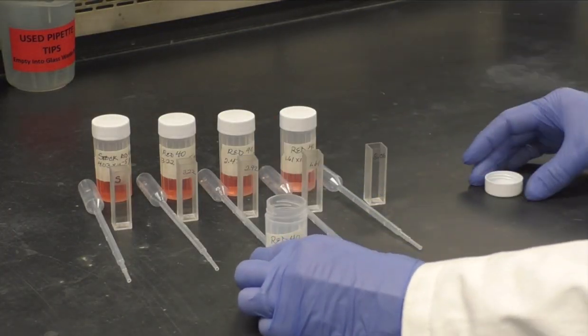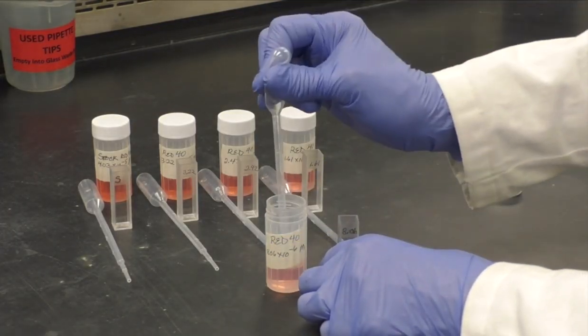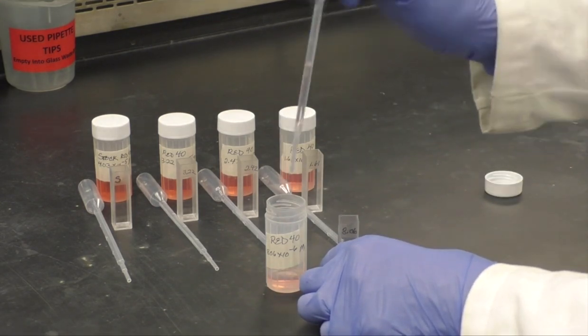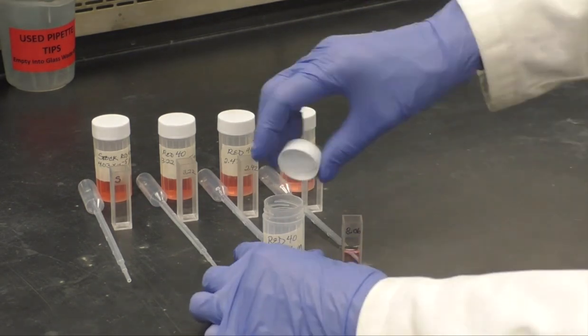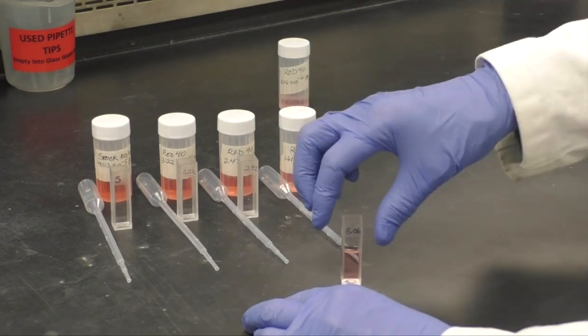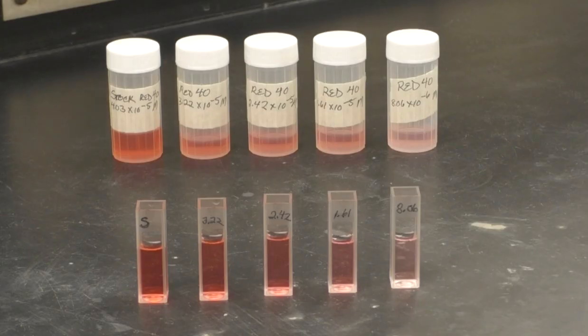Next, fill each cuvette approximately two-thirds full. Be sure to double-check your labels. You will also need a cuvette containing just your solvent. You are now ready to begin taking absorbance readings.